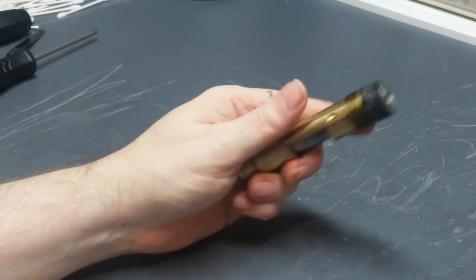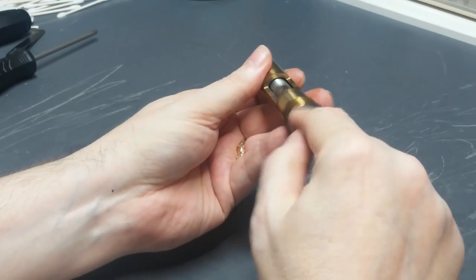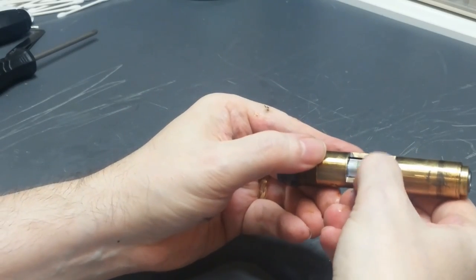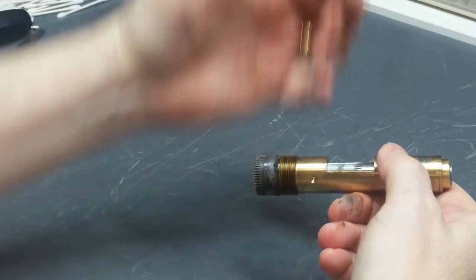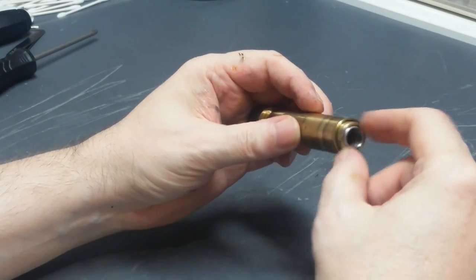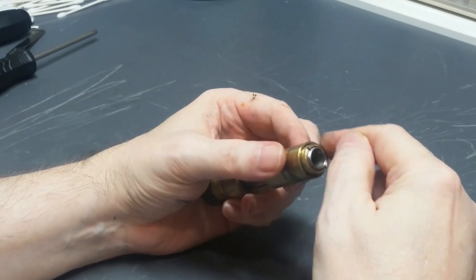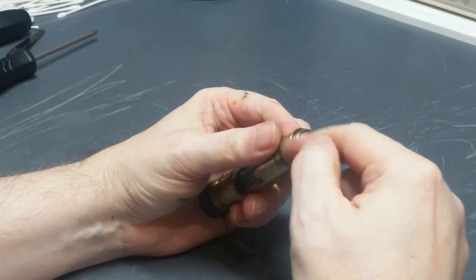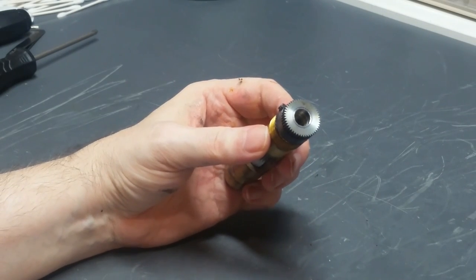Okay, we're left now with just literally the pinion assembly, and this is a hollow shaft with a gear on this end here that meshes with the gears in the knob. There's a gearing around here that meshes with the gearbox that translates motion to the brass rack and raises and lowers the focus block. And over here there's a retaining nut, a little round retaining nut that holds this whole thing together. And inside of here there's 30 little ball bearings. Technically, I think they're called bearing balls, but they're 1/16 inch diameter. And around here, there's another 30. So we'll tear this apart and see if we can get it to clean up.